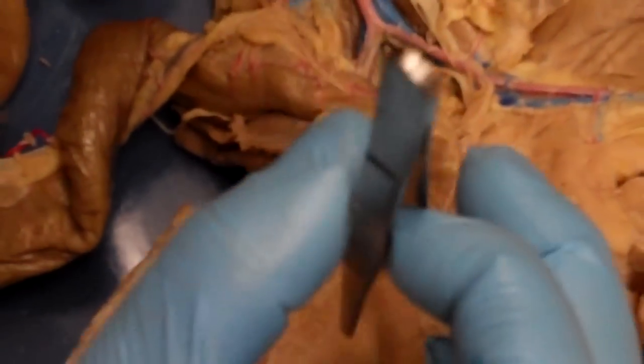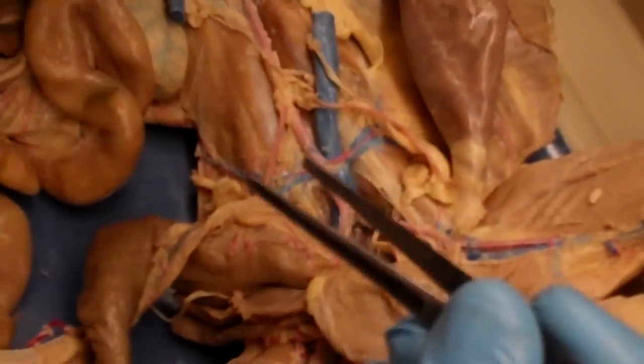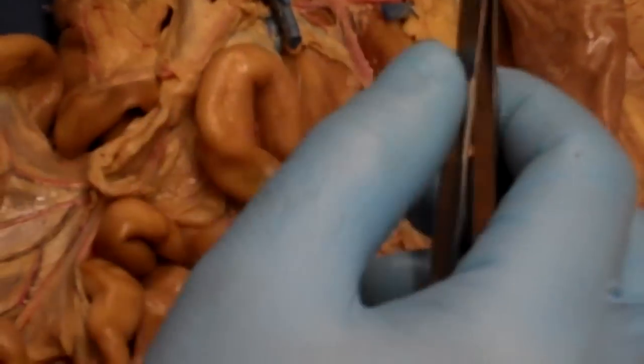The end. So we're doing only the arteries, not the veins. We need to know the veins as well. The good thing is, if you know the arteries, for the most part, you'll know the names. So for a lot of the arteries we've seen, there's just paired veins. The one thing I wanted to show you, too, is we spent time talking about that portal vein, right?